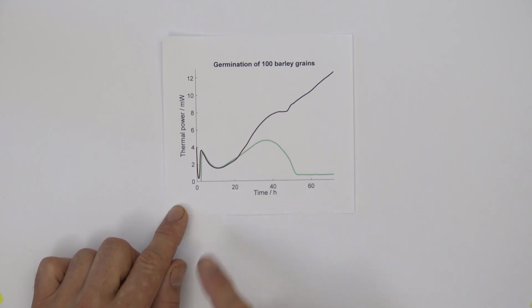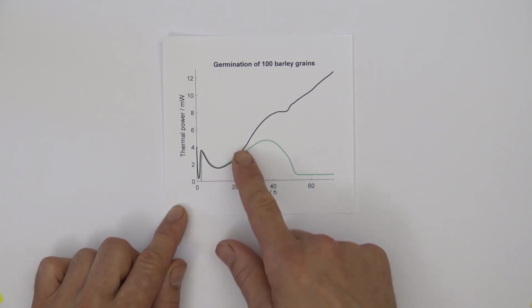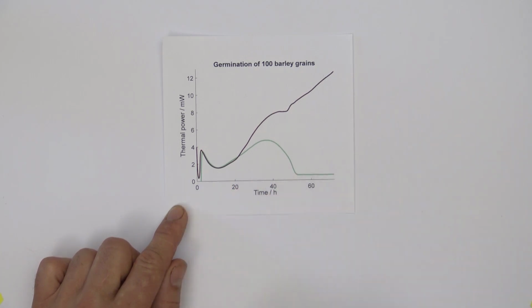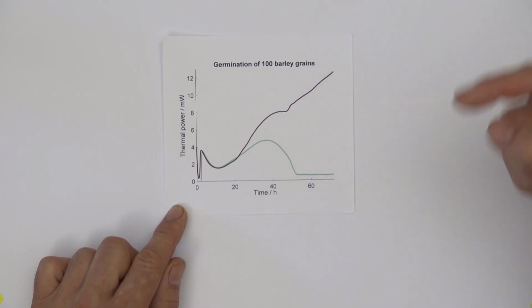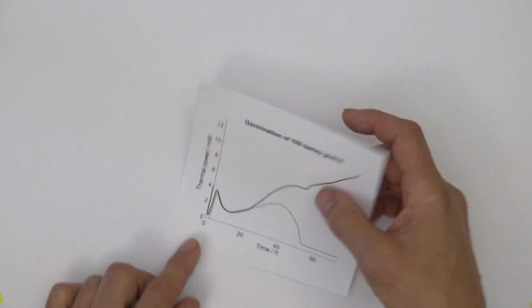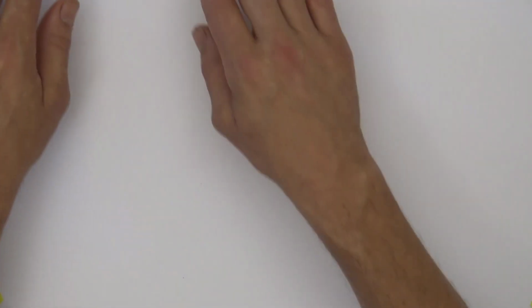And we can see that they don't have enough oxygen, so their respiration slows down, actually goes down to quite close to 0. So there is a big difference between a sample with enough oxygen and a sample without enough oxygen. And calorimetrists working with biological samples need to handle this.